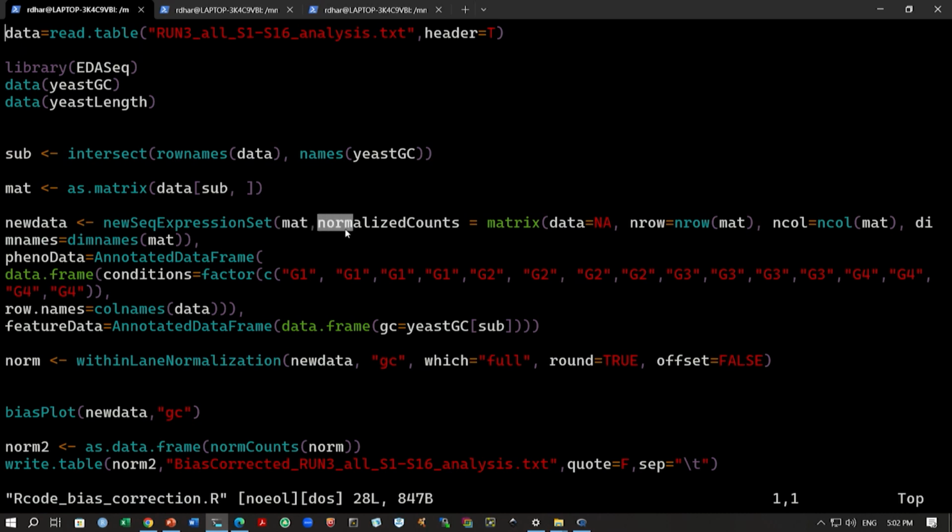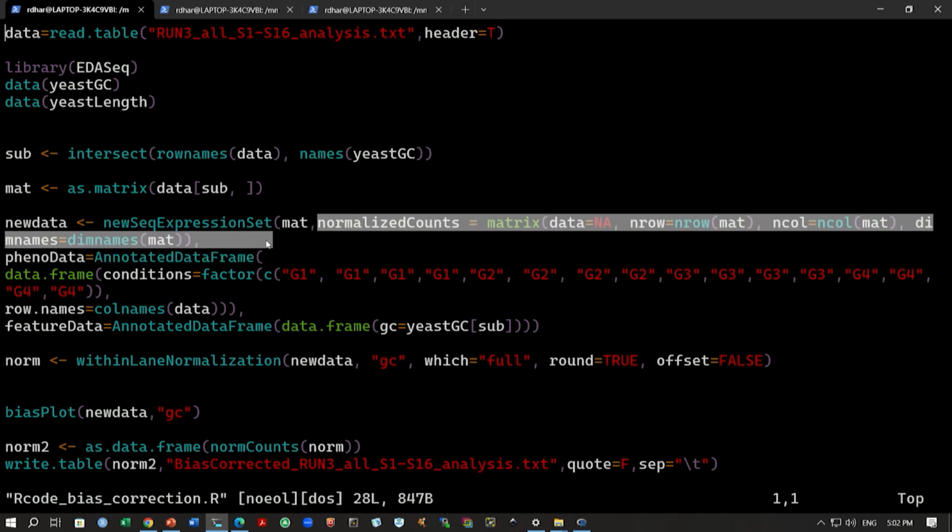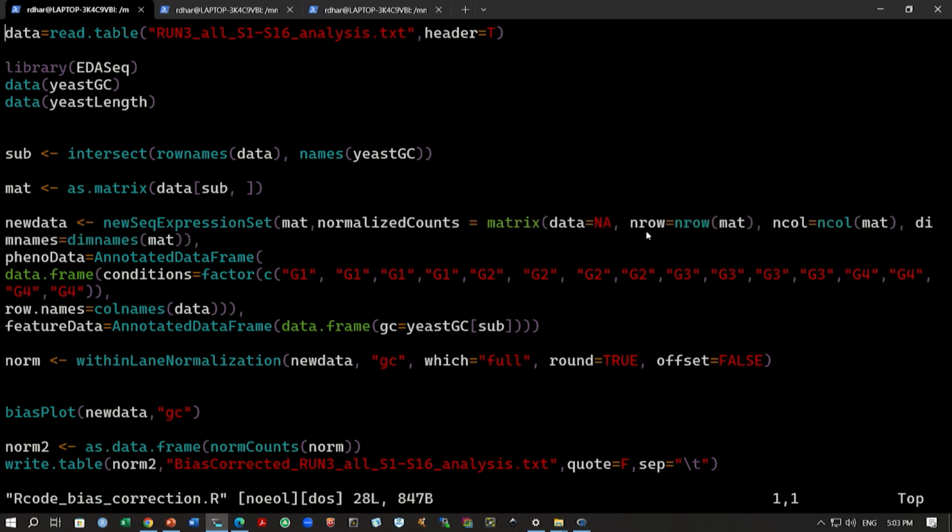Then you can also define this normalized counts variable. The data is in matrix form, but there is no data now; it will be created. The number of rows will be the same as the matrix. Let us say the matrix has 6700 rows; this normalized count matrix should also have the same number of rows, the same number of genes. Then you have the n column. The number of columns should be the same as the matrix, because we have 16 samples here, so we should get 16 samples, and the dimension names will be the same as the matrix. So everything should be the same as the matrix, only the data will be different, generated after the bias correction.